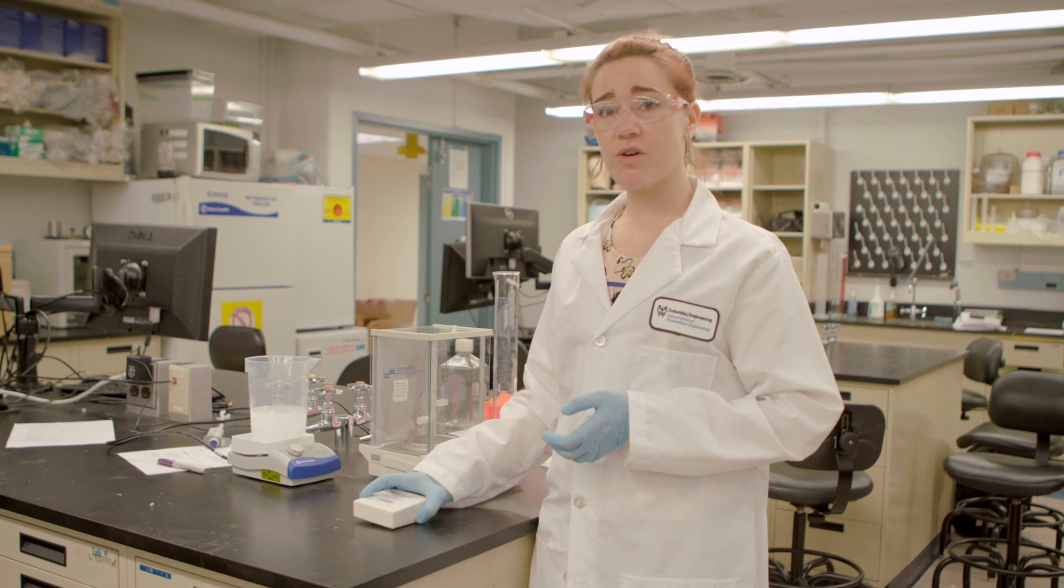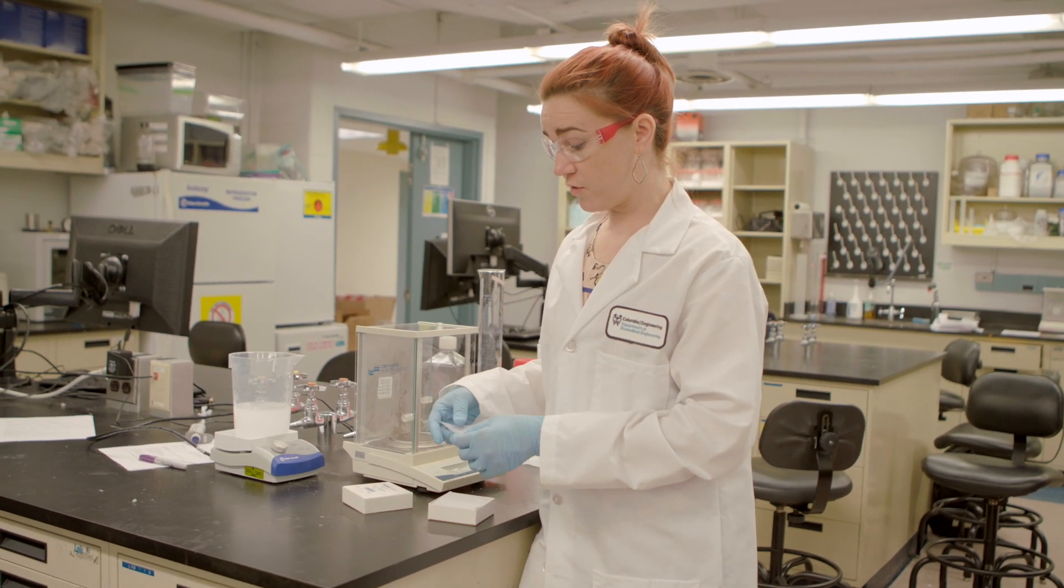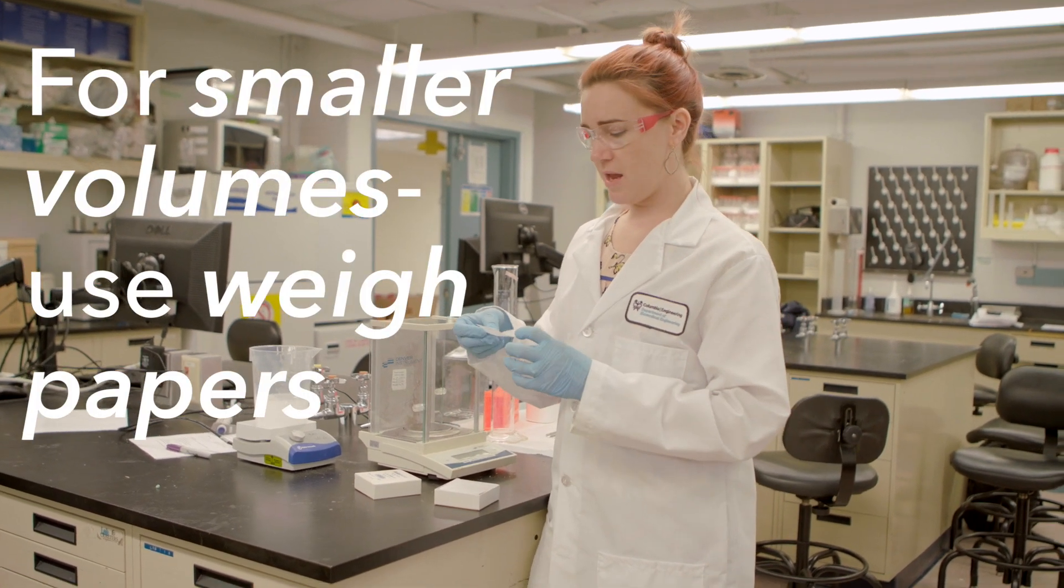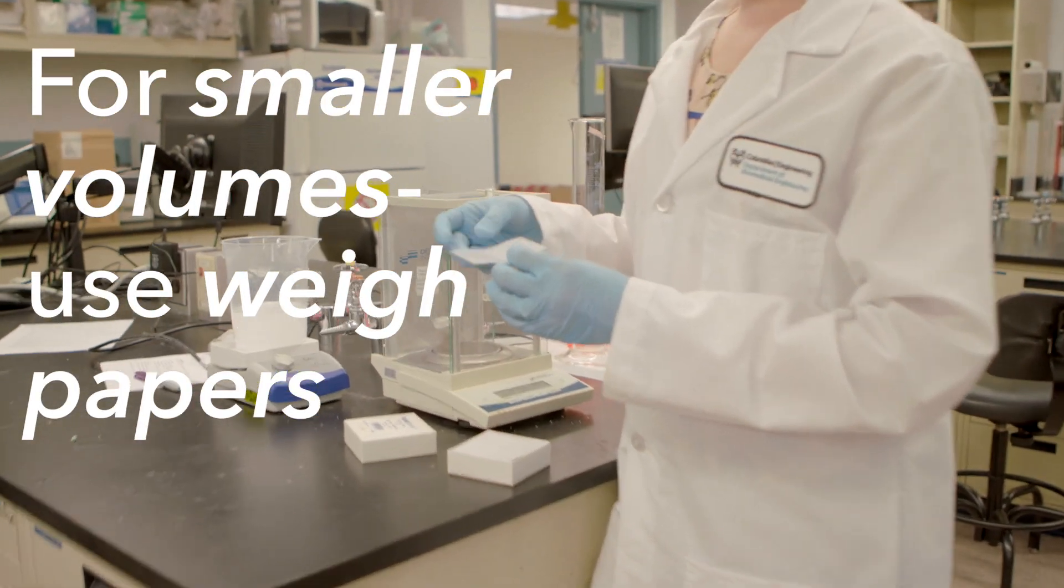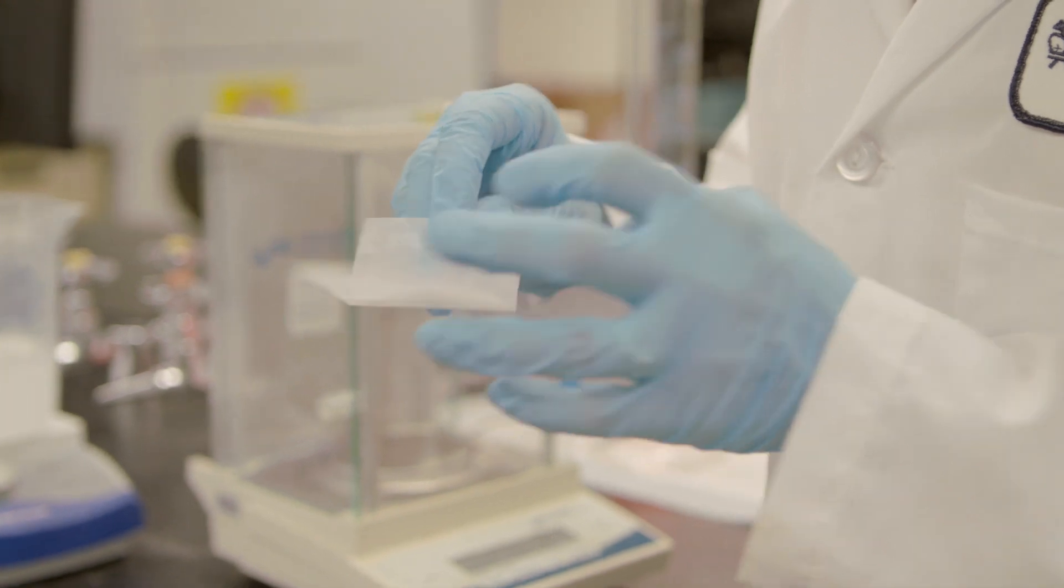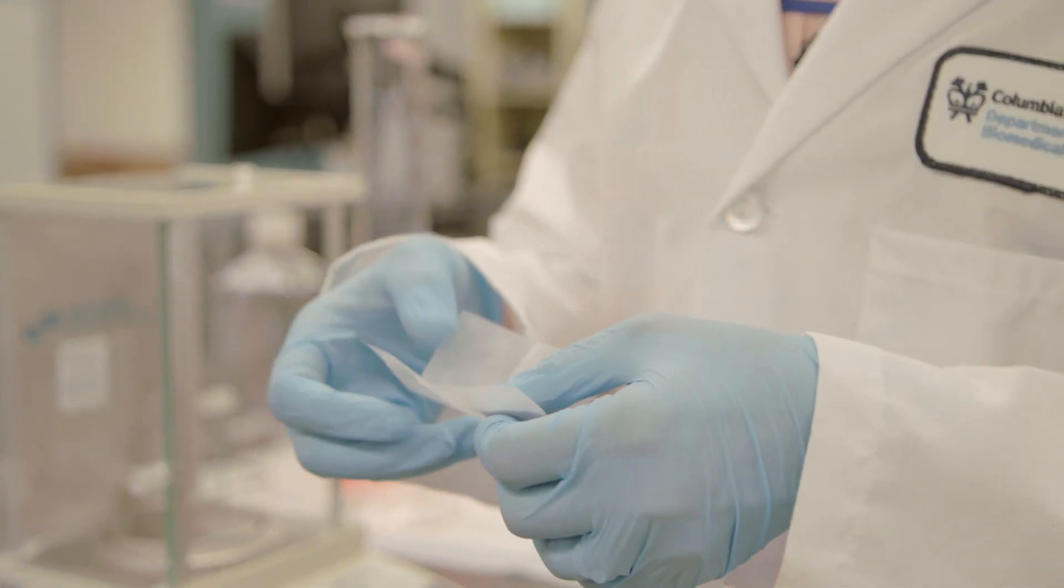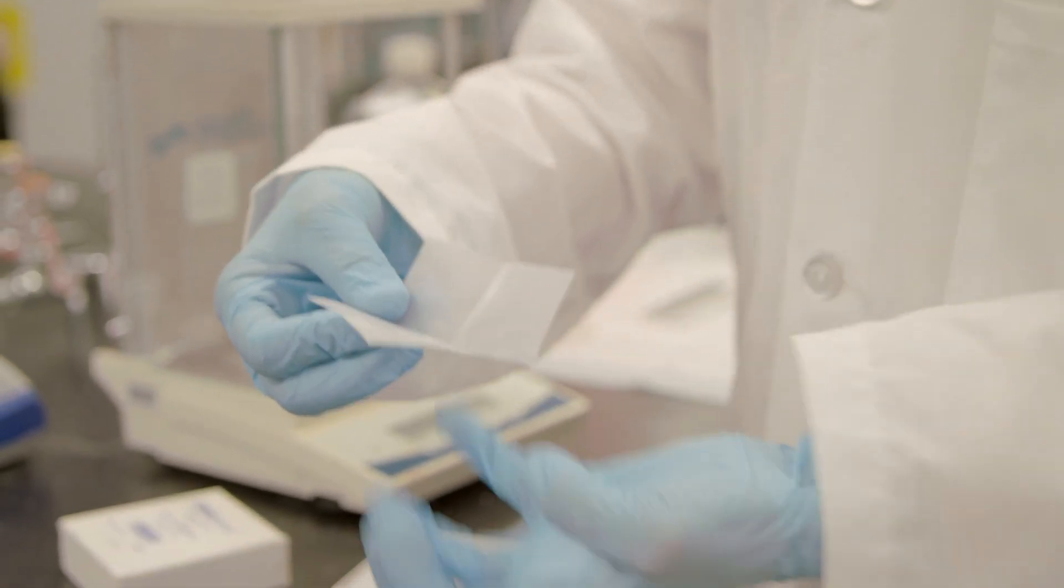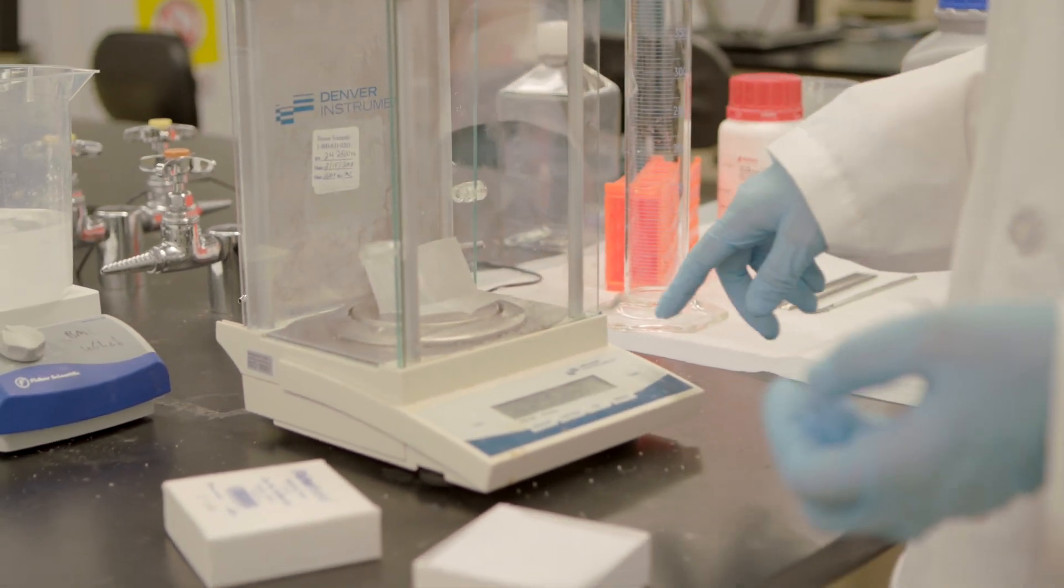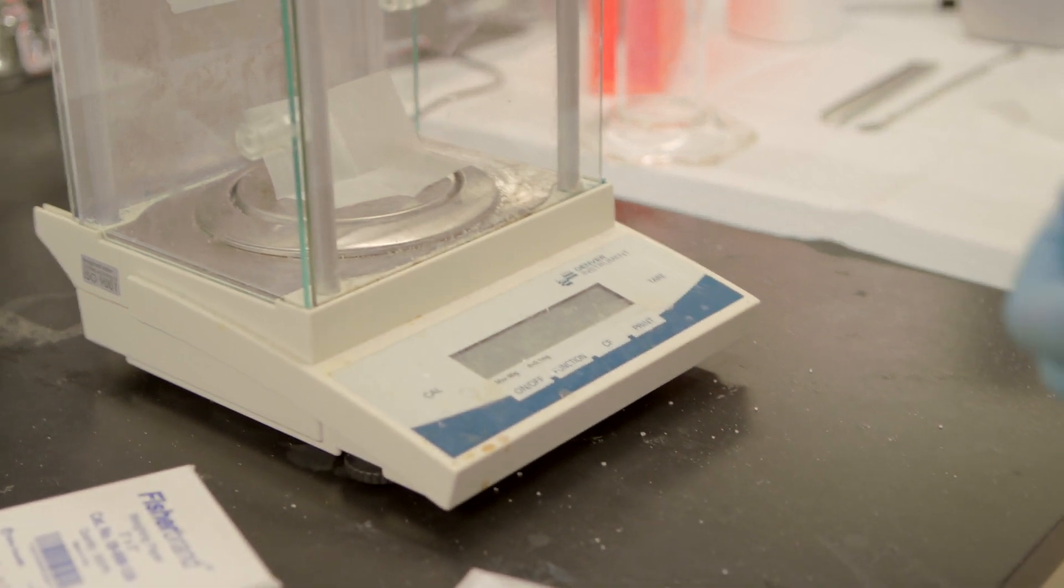While I'm waiting, I can show you when you're measuring smaller volumes, volumes that are just a couple of grams or even less, you can use these weigh papers. They're a little less cumbersome than those boats. A trick for this is to fold the paper in half both directions so you end up with a little well to hold your powder.